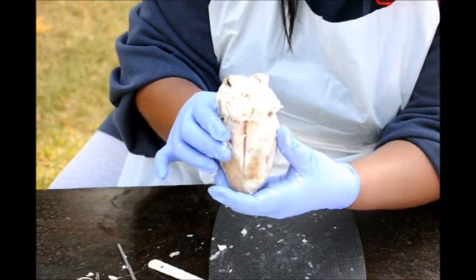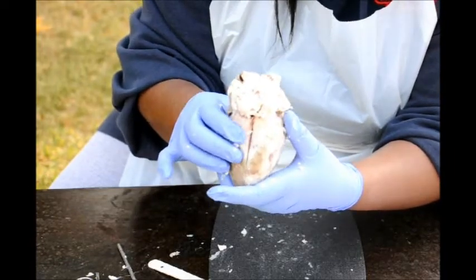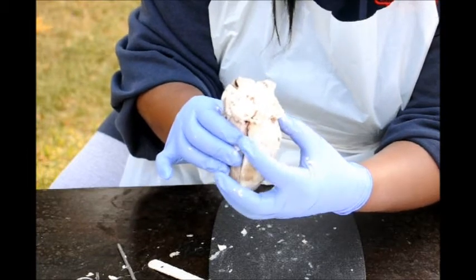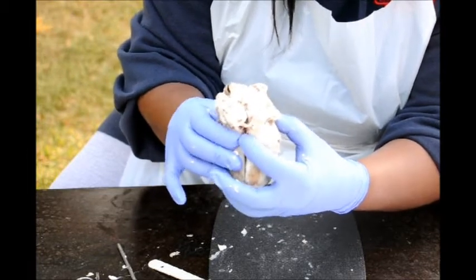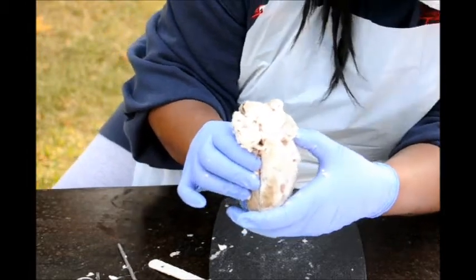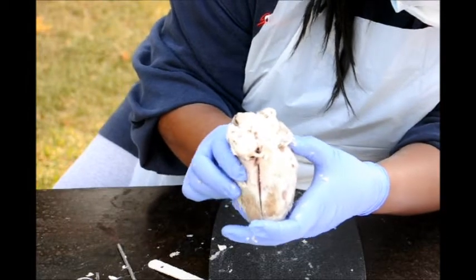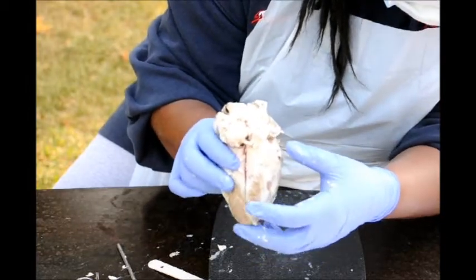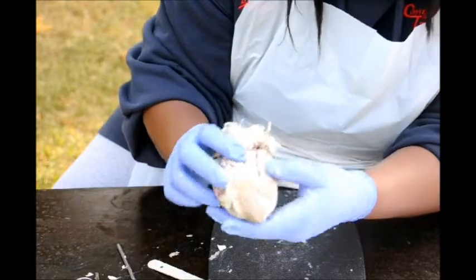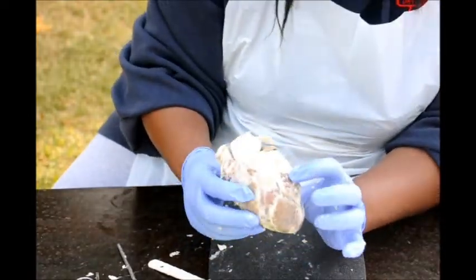The right and left auricles are used to increase the pumping and blood-collecting capacity of the atrium. And the left and right auricles are located, you have to put it this way, here and here.